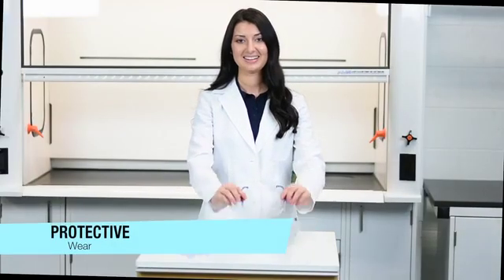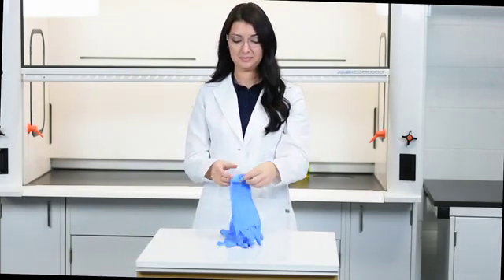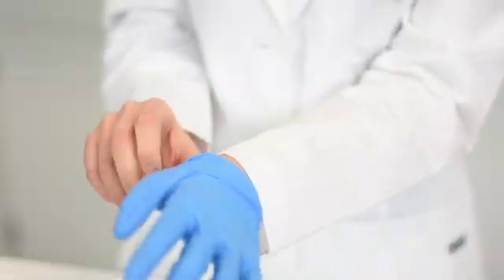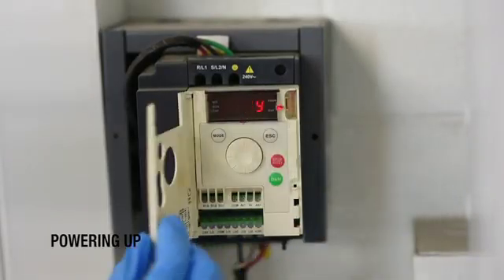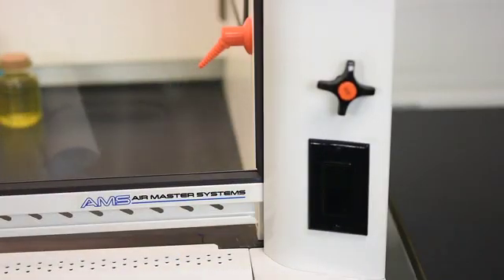Alright, now that we know some of the basic rules, let's put our safety glasses on. Perfect! Let's get our safety gloves on too, just so we don't get anything dangerous on our hands. Alright! Fire up your fume hood by turning on the on button. And let's go right over to the lights and make sure those are turned on also.